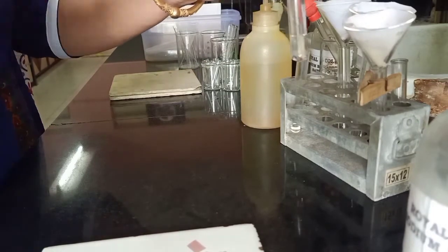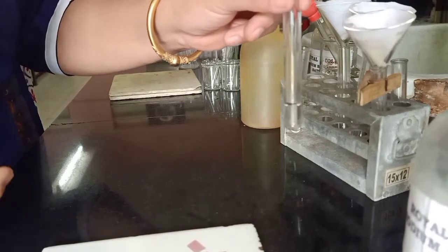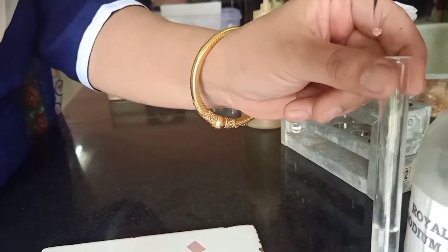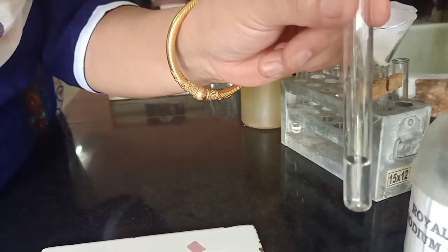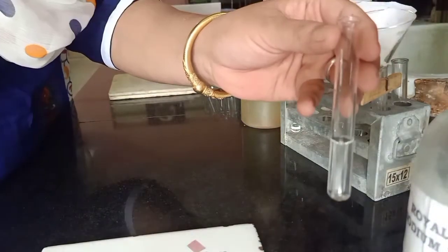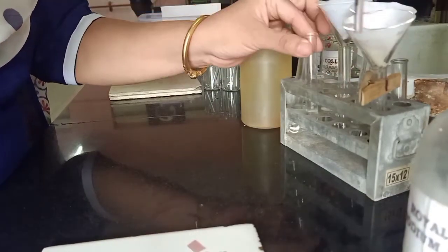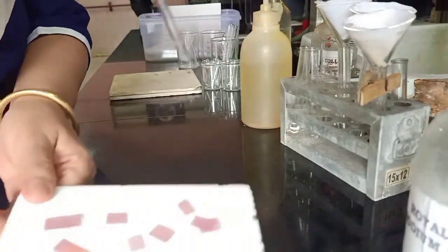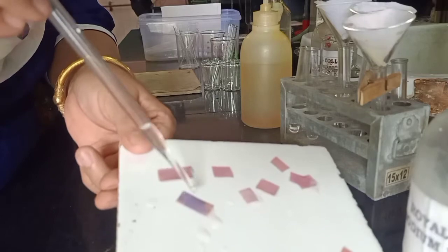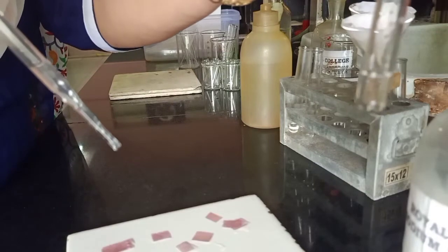Now as you can see it is still red, indicating the medium is still not alkaline. This is an important precaution: when we are not getting re-precipitation, check the medium of the filtrate. If you are adding an acid, the medium should be acidic — blue turns to red. This time we are adding NaOH, so the medium should be alkaline — red turns to blue. Let's add a little more sodium hydroxide. As you can see, red has turned to blue, clearly indicating the medium is alkaline, but still there is no re-precipitation.